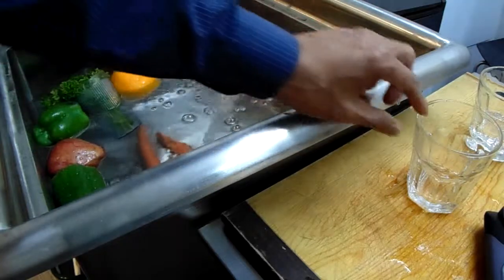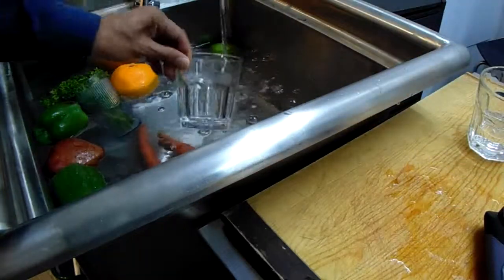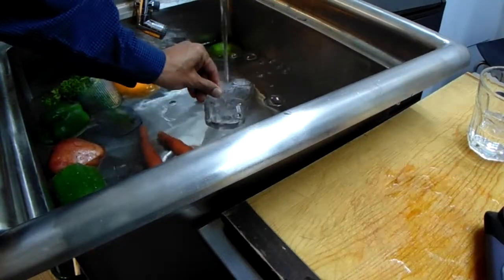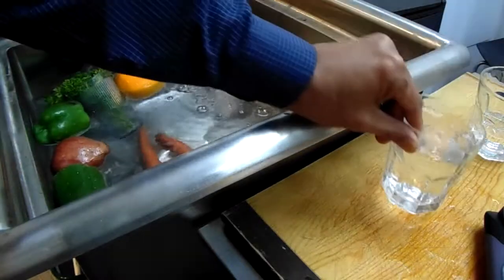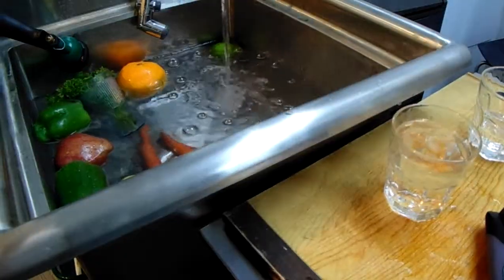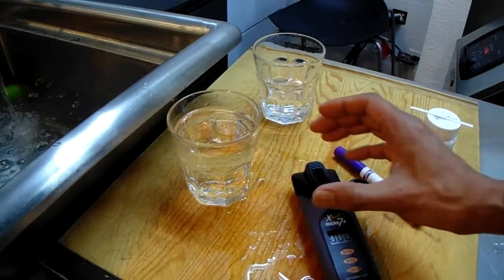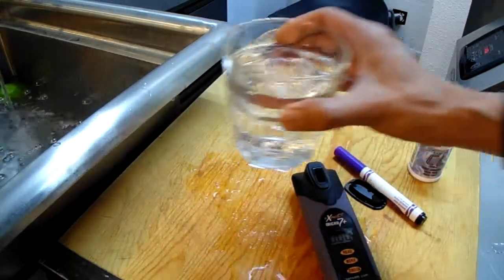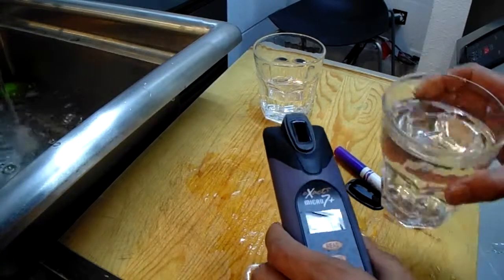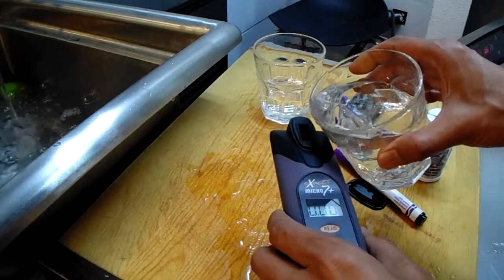So I'm going to take some of this water right there. I'm simply going to take this water and fill the meter up.